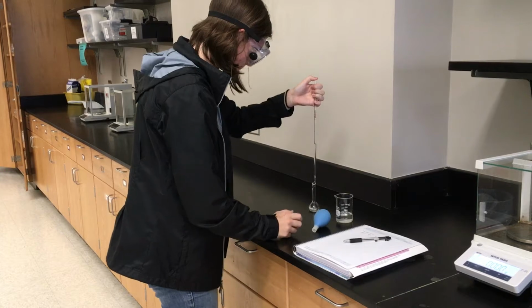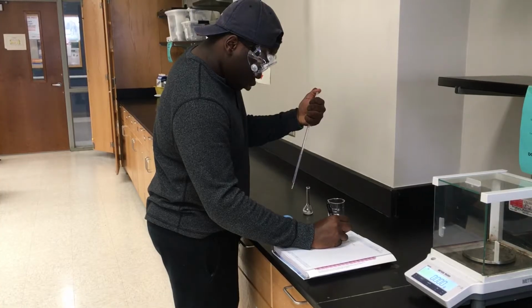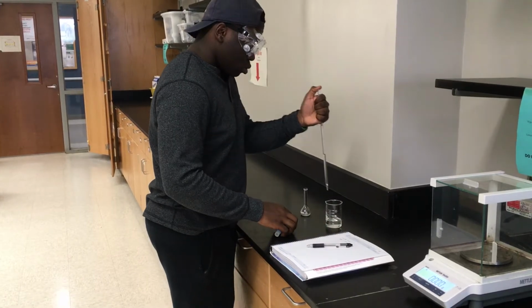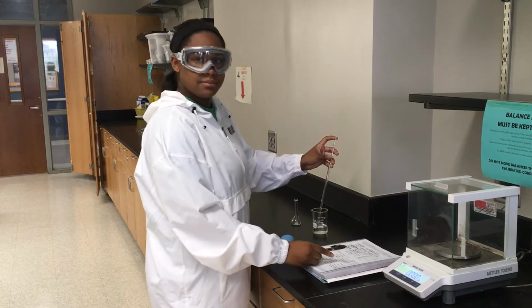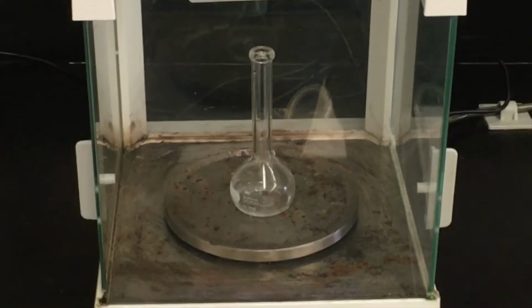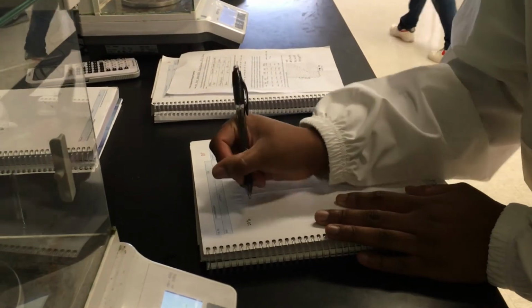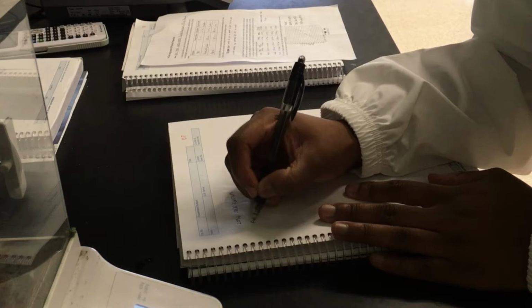After releasing a portion of the volume into the volumetric flask, you will again need to record the final volume in the pipette for your notebook. This observation is necessary in order to determine the volume of the stock solution now in the volumetric flask. The equation for this is final volume minus initial volume.